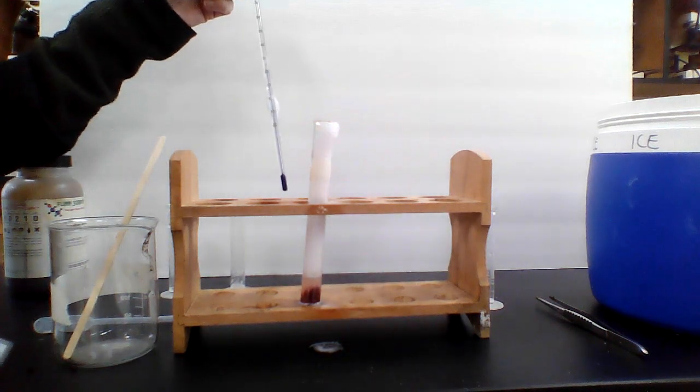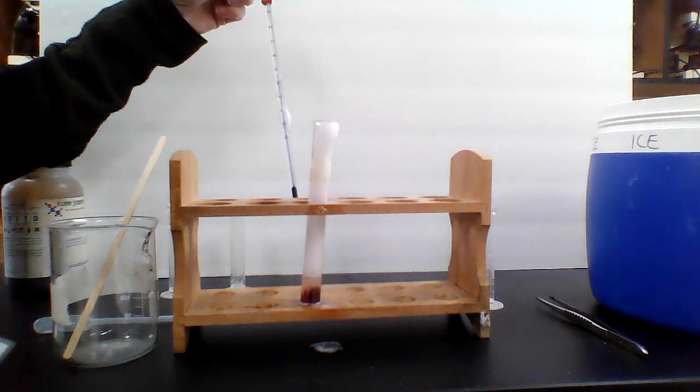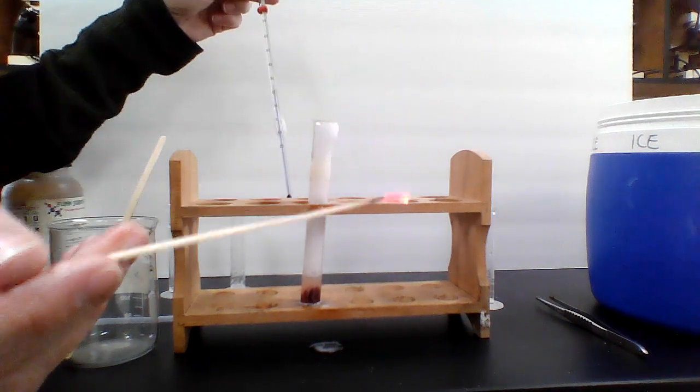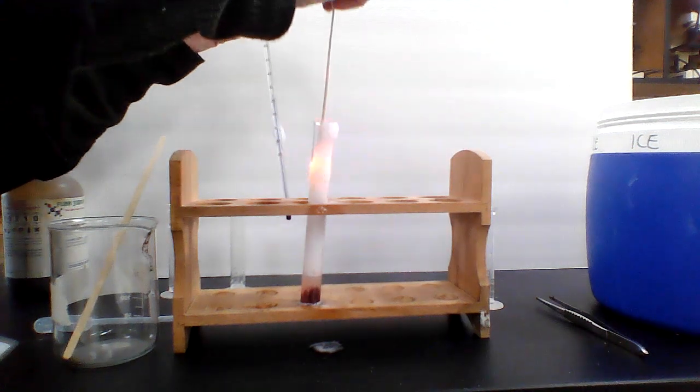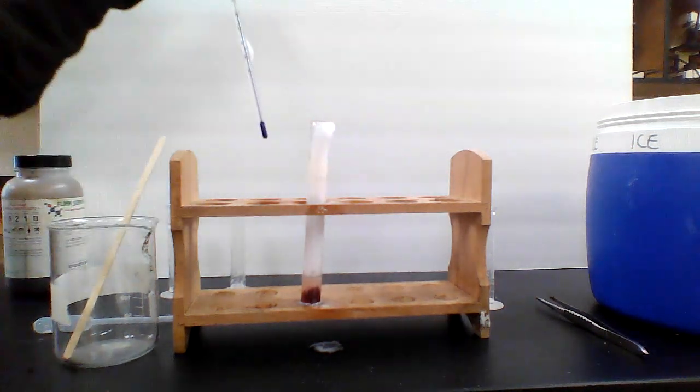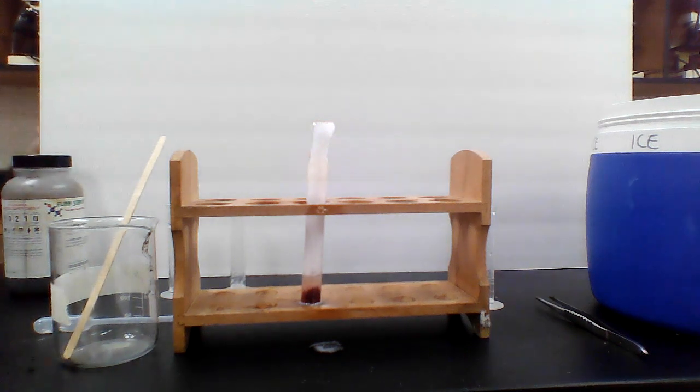So that's definitely a positive test with that one. That's what we would expect. See if I can get it to do it again. I can get it to blow out now. There we go. So let's try it. See if we can get it again. Yep, I've made a little flash. I don't know if you can see that on the screen there, but we'd say it's a positive splint test, and the temperature is 29 degrees.